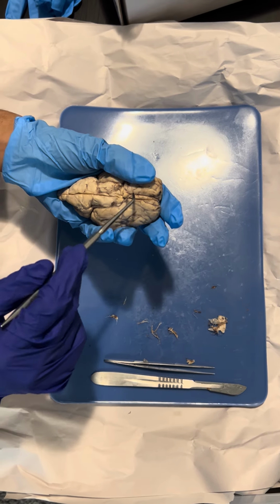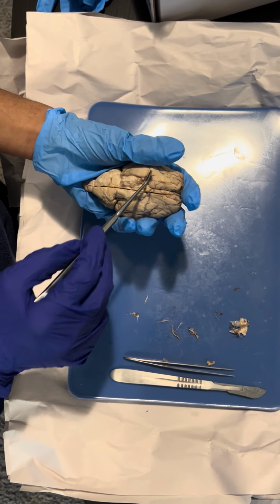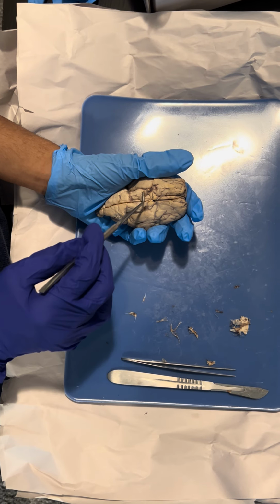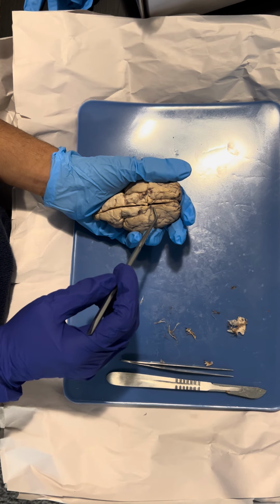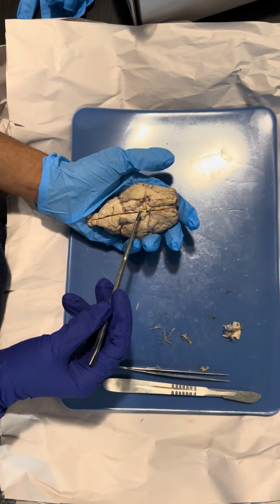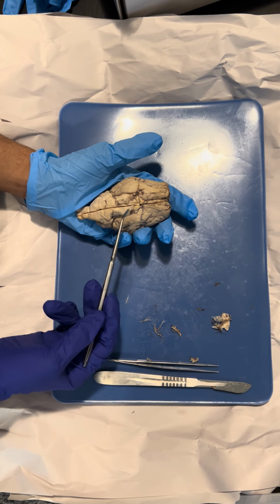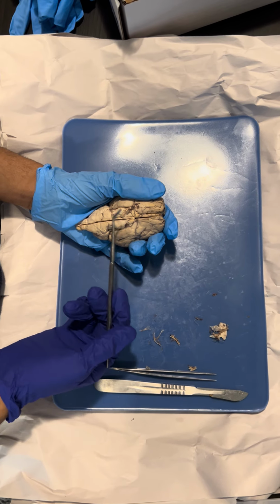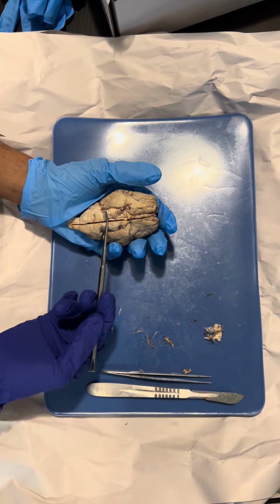And then there's kind of an X-shaped marking, which is not clear because of the dissection, but there is an X-shaped marking over here that shows the optic chiasma, and it's where the crossing of the optic nerves takes place. And then also over here we have, which is not shown, the cranial nerves, and these basically control the face, hearing, eyes, as well as mouth, taste, etc.